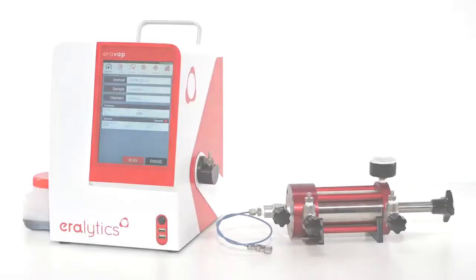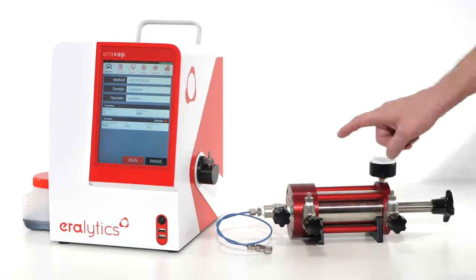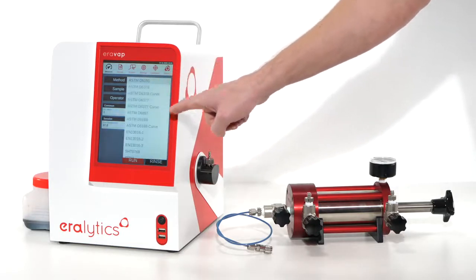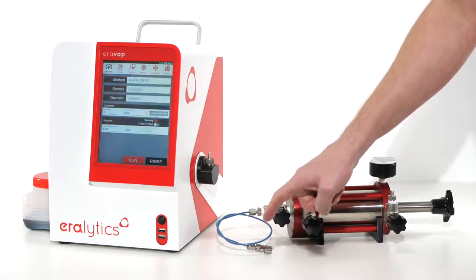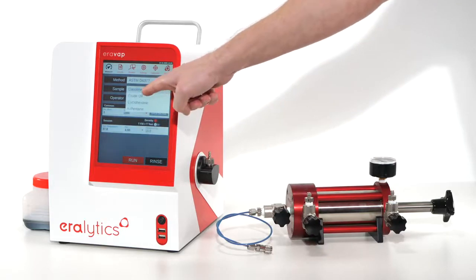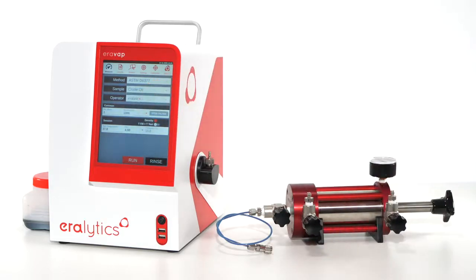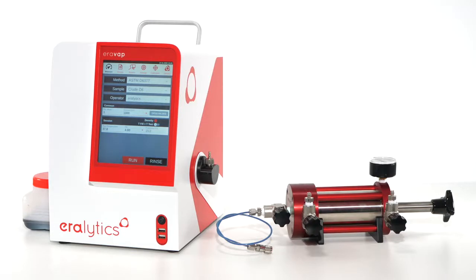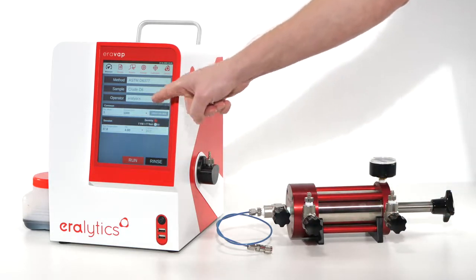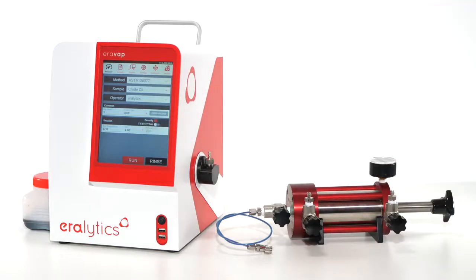Select a crude oil vapor pressure test method of choice on the measure screen, such as ASTM D6377 or TVP, and enter the sample ID. The density measurement can be activated for most of the available vapor pressure test methods, which is then visualized by a corresponding red indicator.